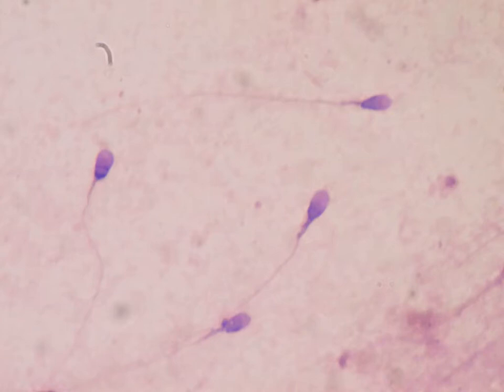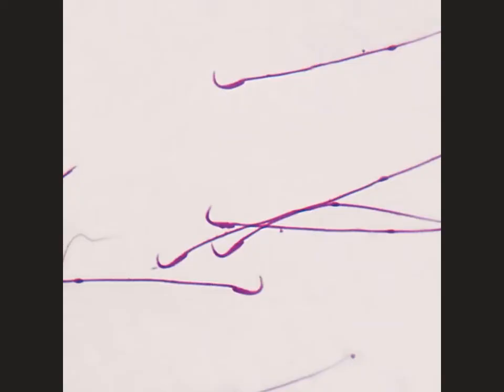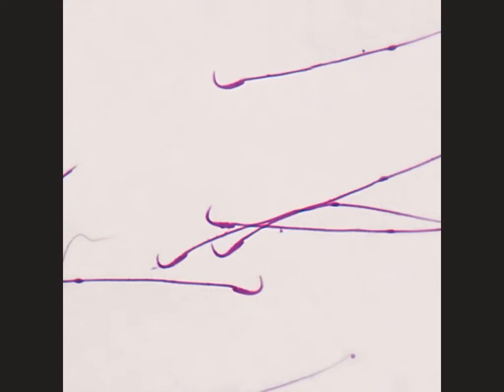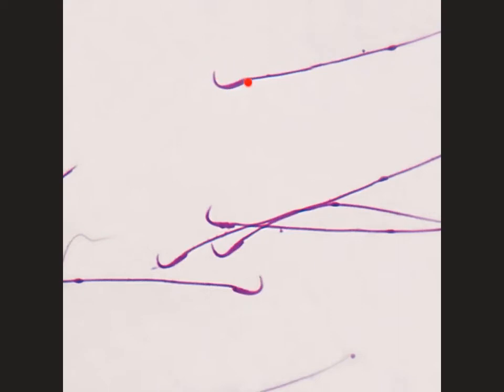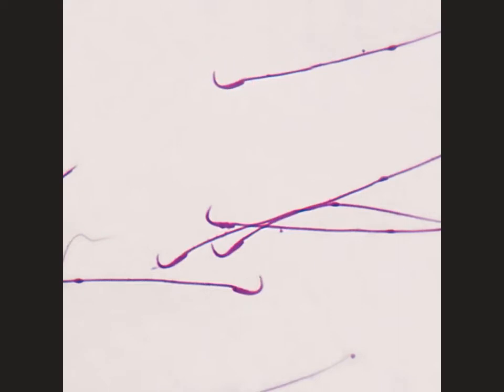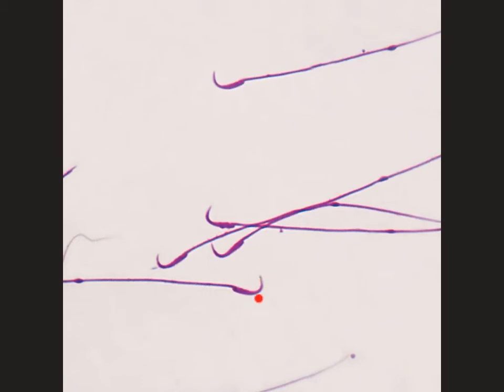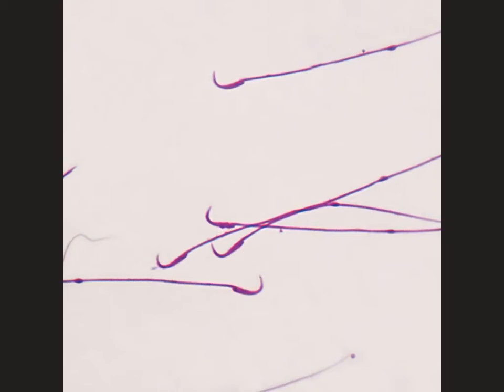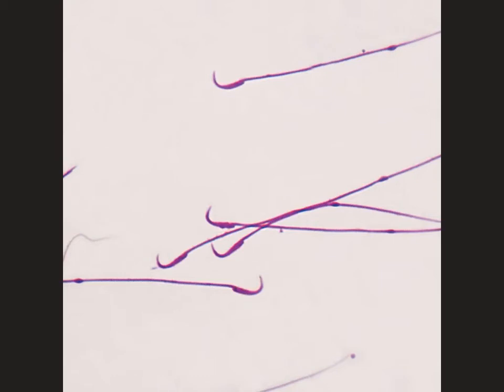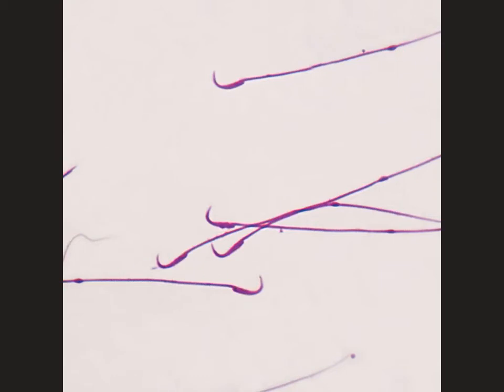These are human sperm. These are rat sperm, which are a little different but very similar — they still have a head, a midsection, and a tail. In this case, though, the heads are shaped a little more like hooks. Rats are very serious about their fertility. You can also see the very long tails.